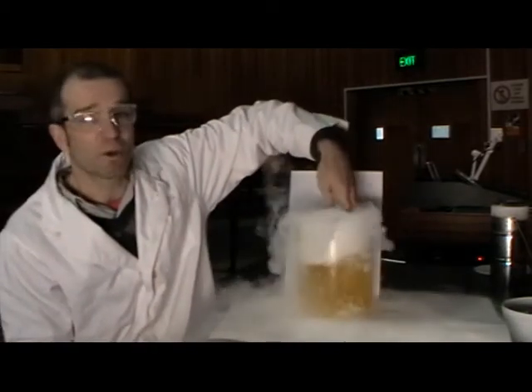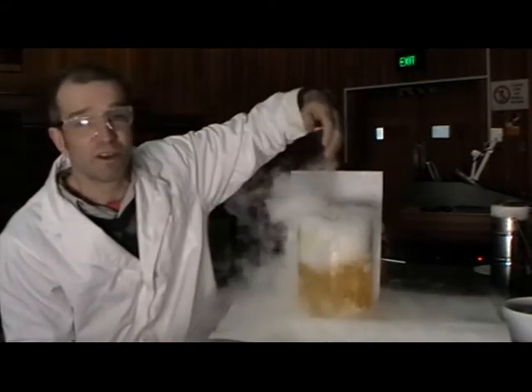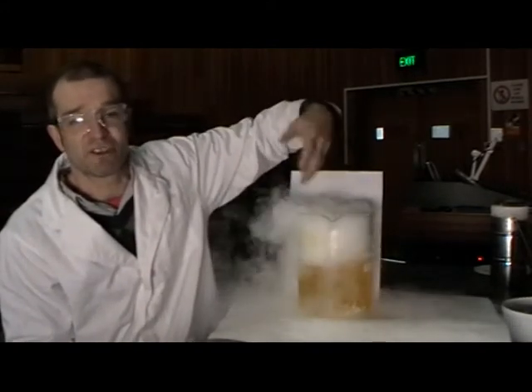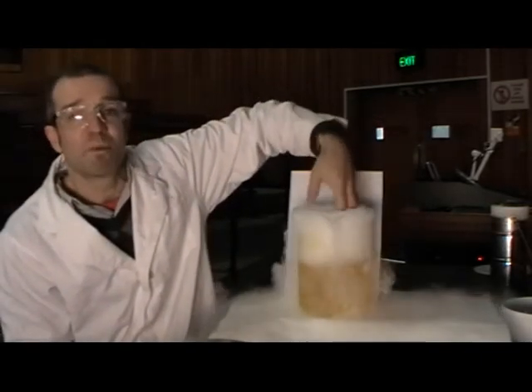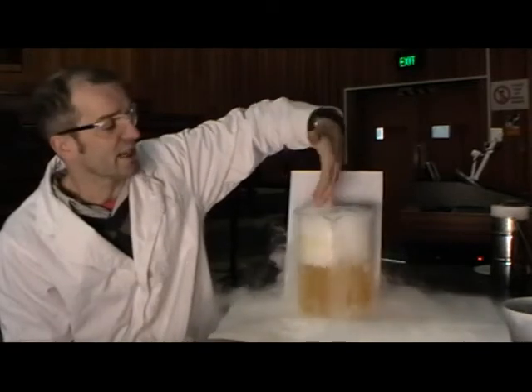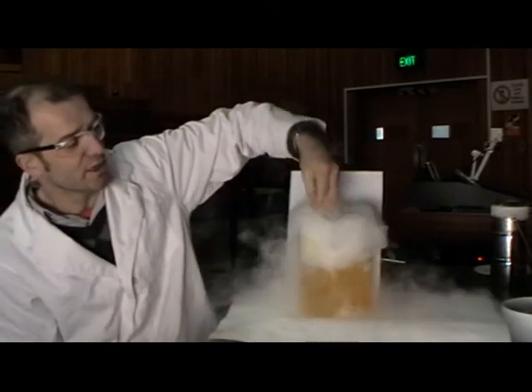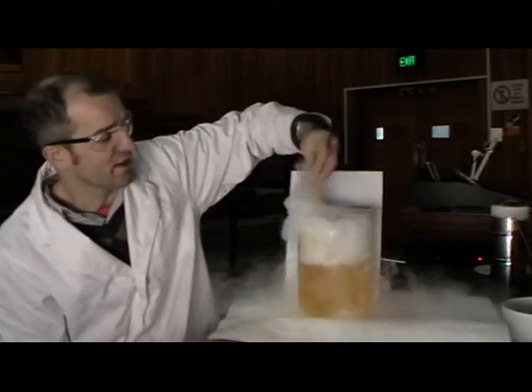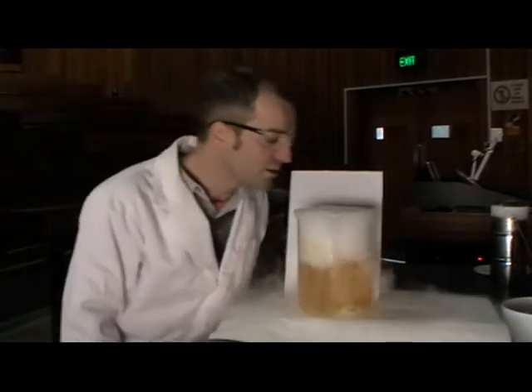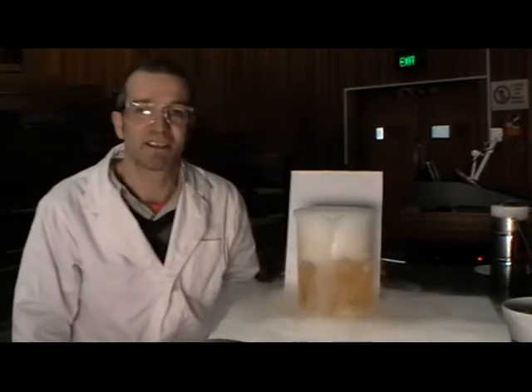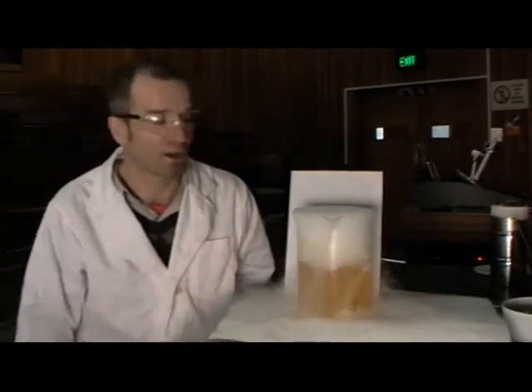The carbon dioxide is so cold that when we warm it up in the temperature of the solution, it starts to turn into gas pretty quickly. We're not actually seeing the carbon dioxide gas here, but the carbon dioxide coming off is so cold that it's causing water vapor. So I'm effectively putting my hand into cloud here in the solution. We can use this to produce cloud. It's pretty tasteless and odorless, just carbon dioxide. It's got that little bit of a smell you sometimes get when you open a bottle of Coke.